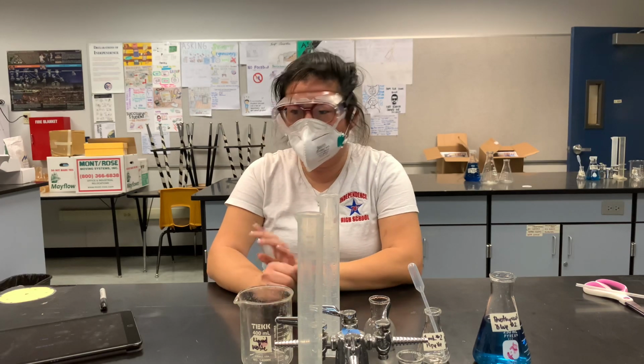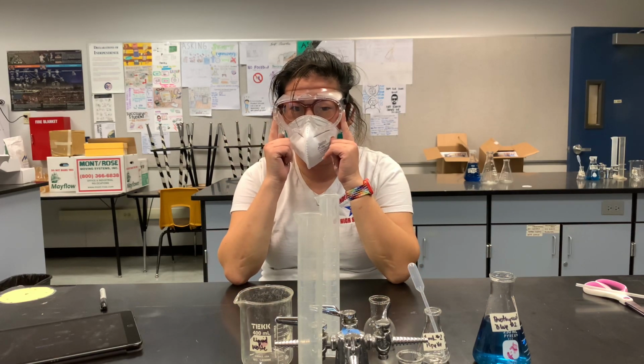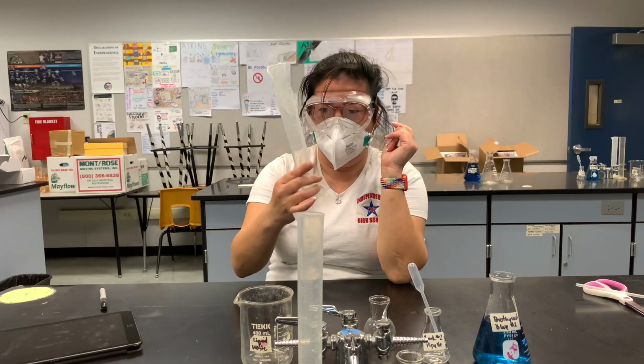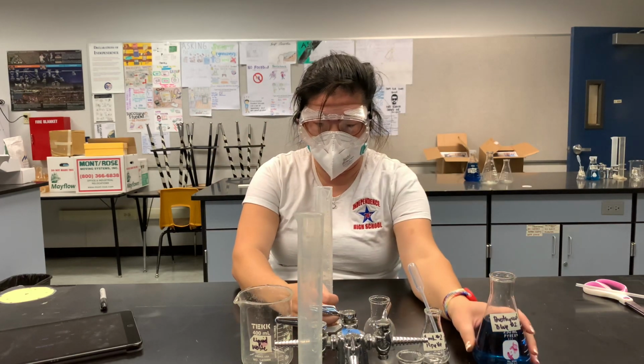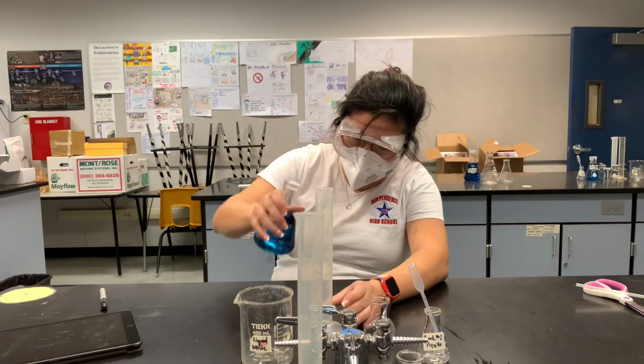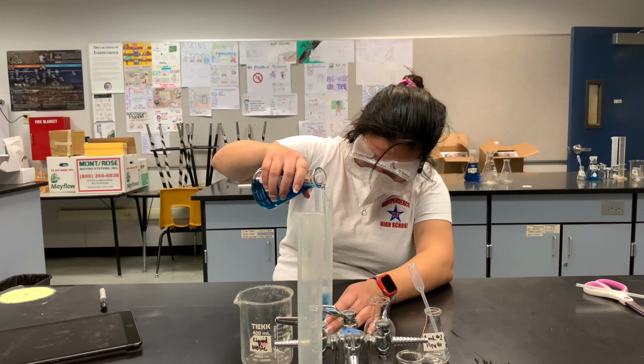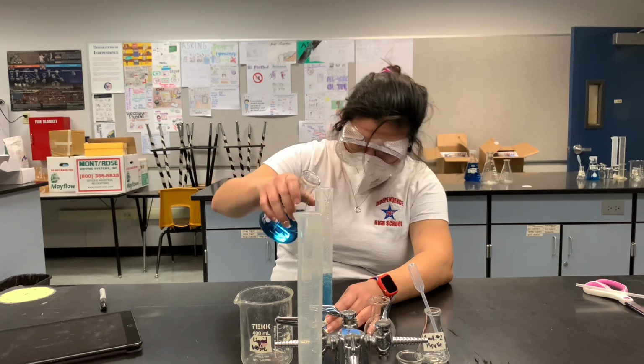Okay, let's go ahead and do the procedures. First, put on your goggles. Second, you're going to measure out 50 milliliters of bromothymol solution. You're going to use this first to pour, and we want to get to 50 or close to. Once we get close to 50, so we don't go over, you're going to pause.